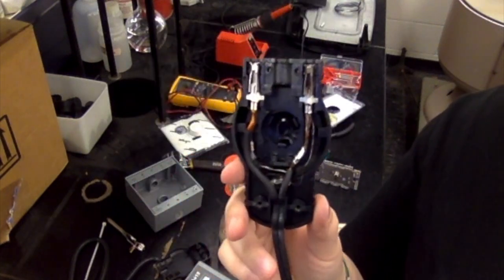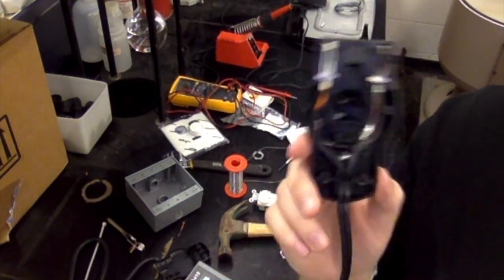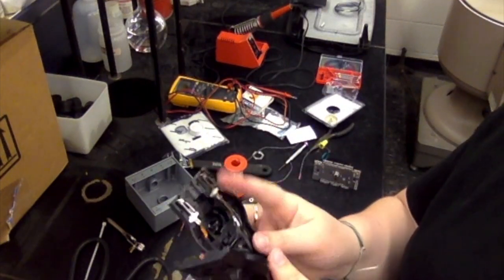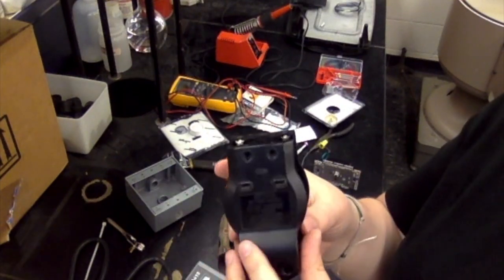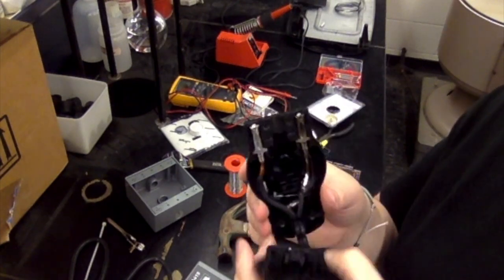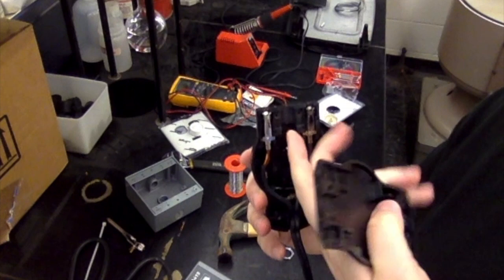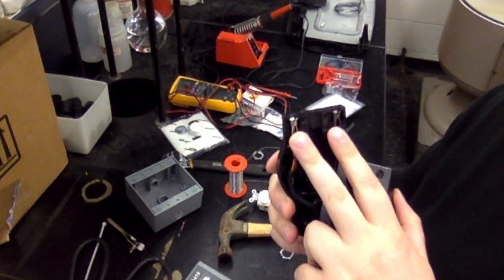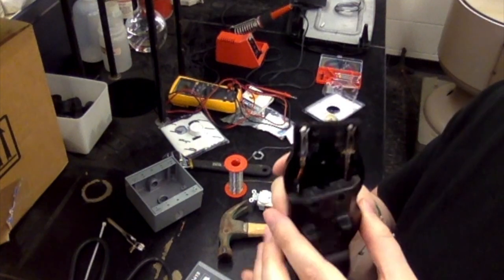These are all the modifications that you need to make to the stock controller, so it's actually finished. Once you feel comfortable that your solder has cooled down, you can go ahead and put the back piece on. Two notes. The first one is make sure that these pieces here are seated properly. Sometimes they like to slide down, and that will cause issues later. You want to make sure they're seated.